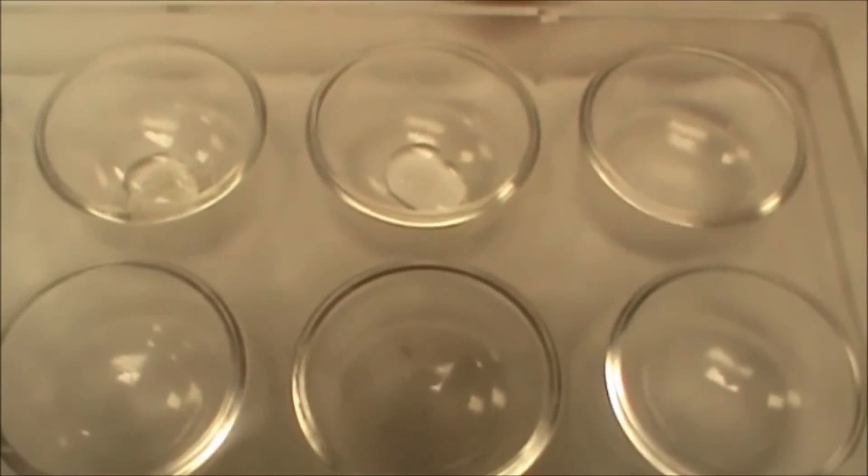We're going to go through how you do the halide test. So what I've done is I've put a drop of four different chemicals into the well plates.